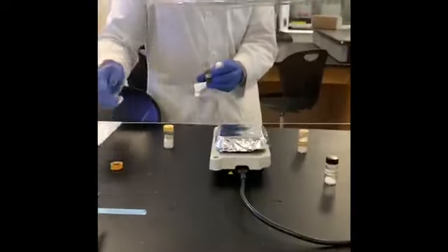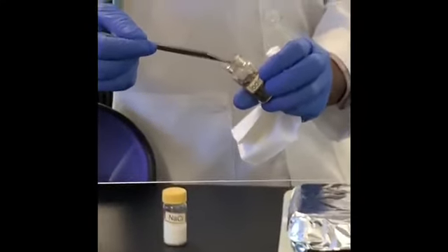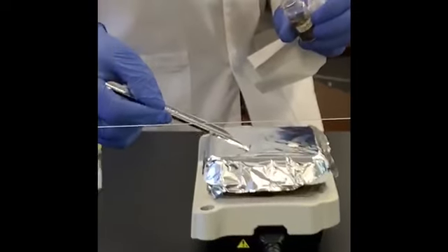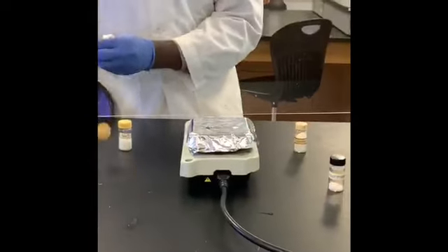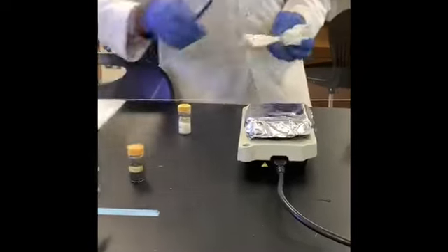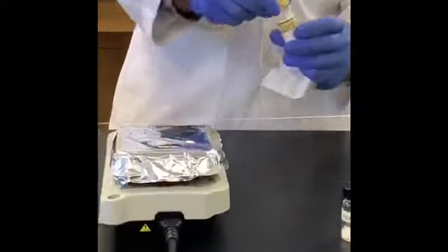Take a few crystals. This time we have iodine here. Take a few grains on its own spot. Please make sure they are far apart. They shouldn't touch each other so that they are not interfering with the action of each. Clean up again. Take the next sample, this time sucrose.